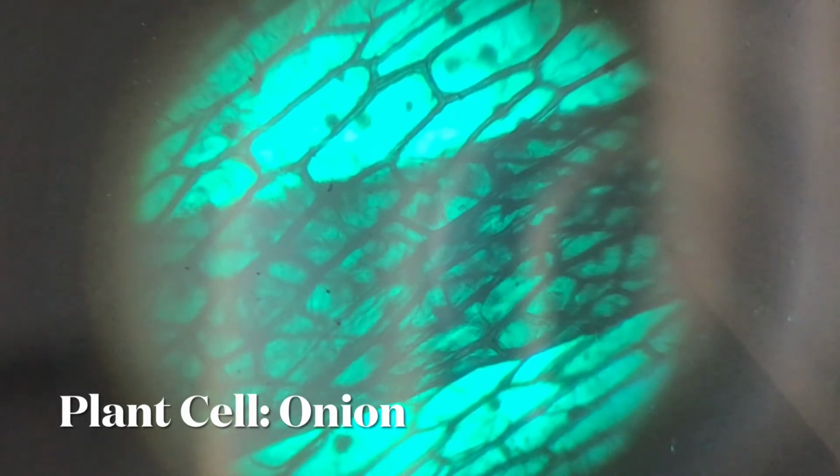Now you may not be able to see the chloroplast or some of the other parts of the cell yet, because you will actually need to zoom in to a more powerful magnification in order to see that. But in today's activity we are just looking at how a plant cell looks like.